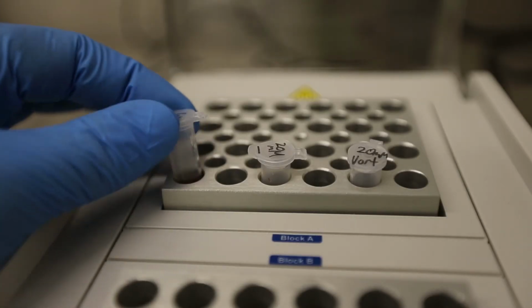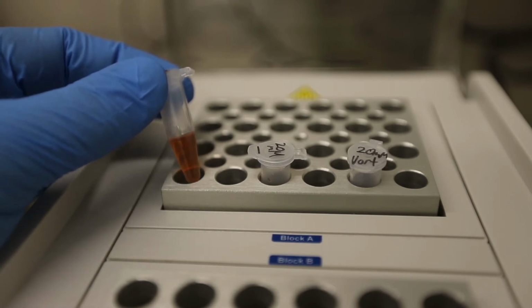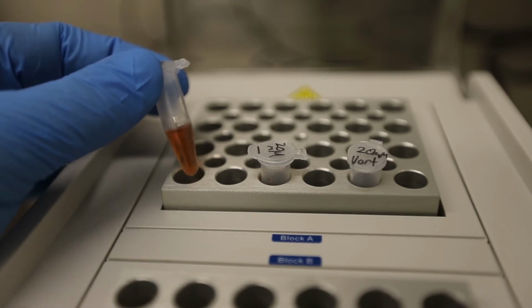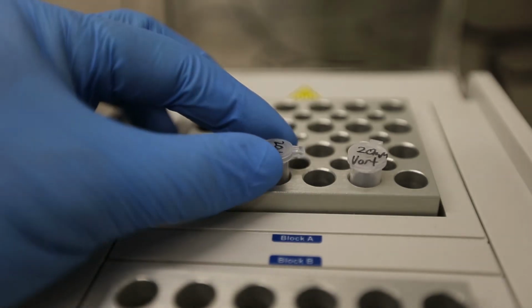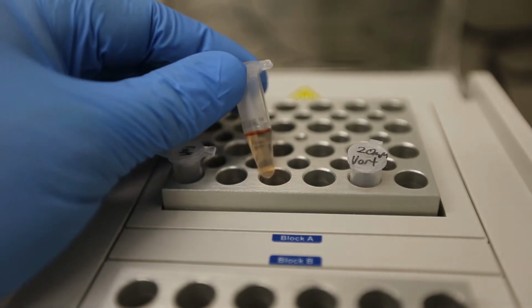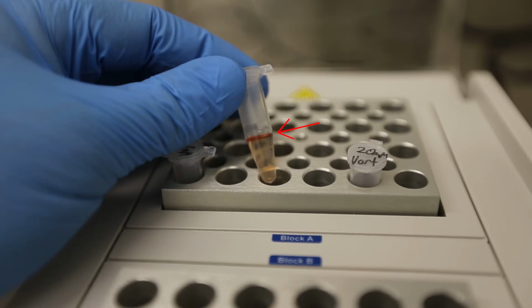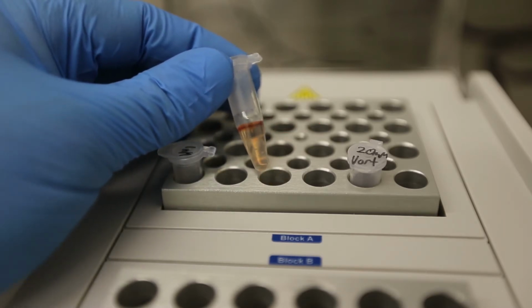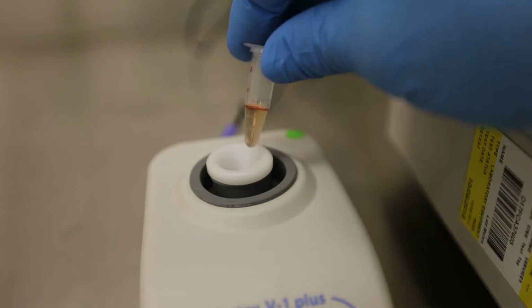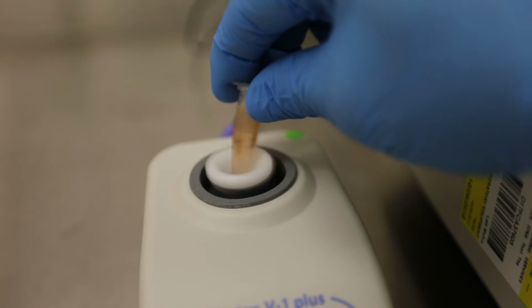After incubation, we see a pronounced colour change in the glucose standards. You'll notice that in the lower concentration standards, the colour change will be uniform. In the higher concentration samples, however, the colour change only seems to occur at the air-liquid interface, probably indicating some sort of oxygen dependence. If you vortex the sample quickly, the colour change will develop throughout the rest of the liquid and you will end up with a sample in which the colour change is uniform, which is what we're after.